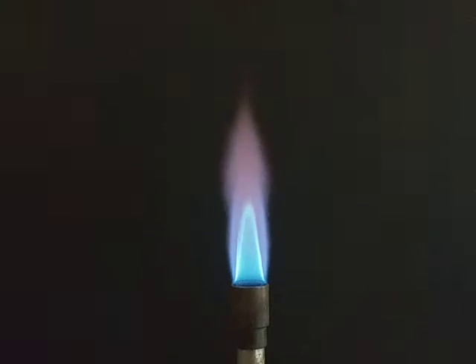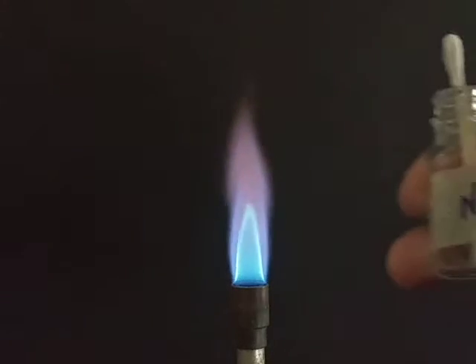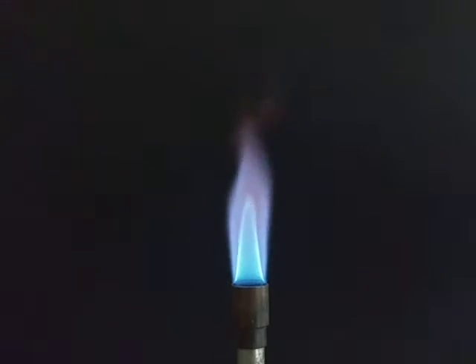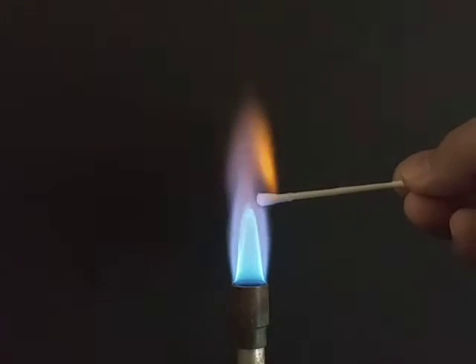So you have at home or in your Google Classroom account, you should have the template I gave you for the lab report format, and there are 7 chemicals that we're going to do. Like this one right here says Na for sodium. It's actually a solution of sodium chloride that's dissolved in water, but it has sodium atoms in here. And so I have a Q-tip that's been soaked in the chemical, and then I'm going to put that in the hot part of the flame.